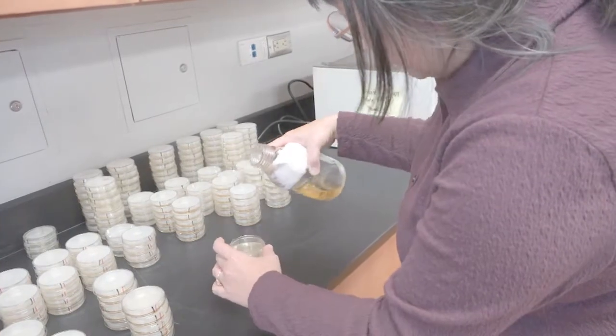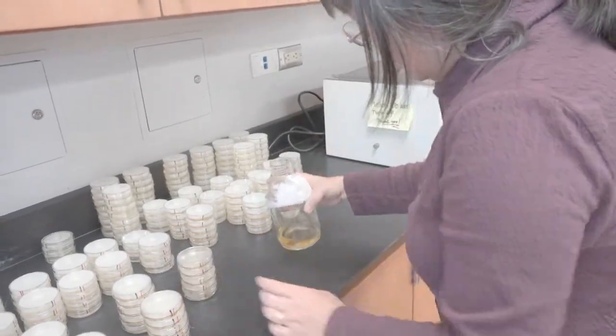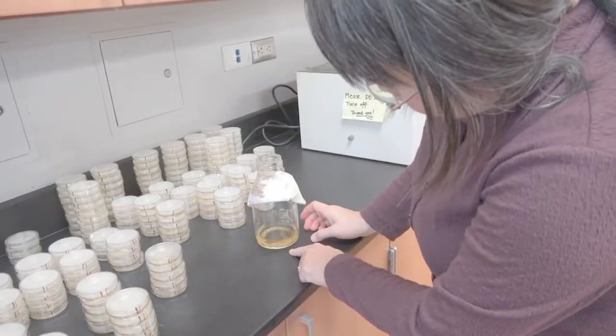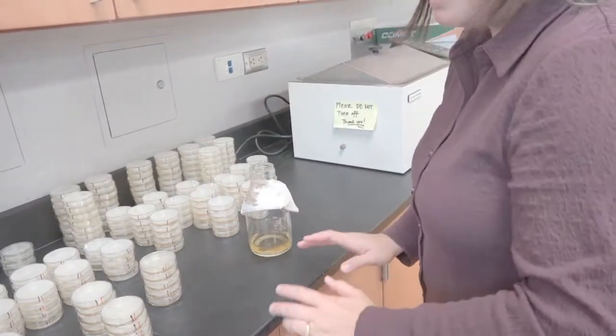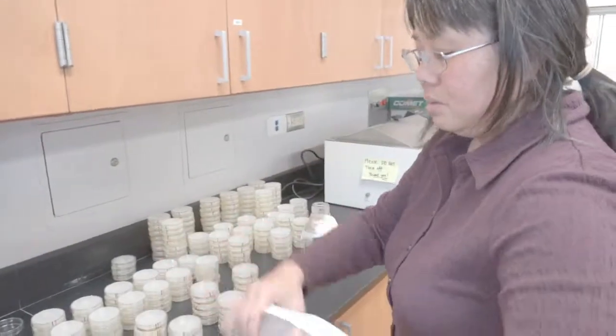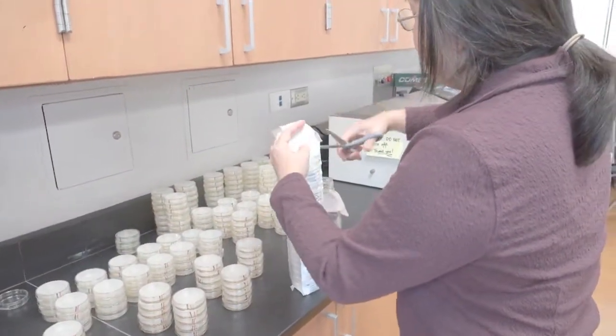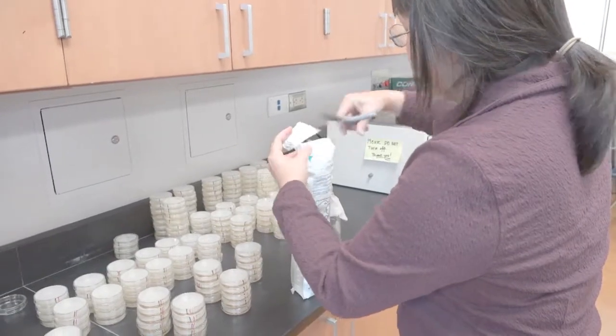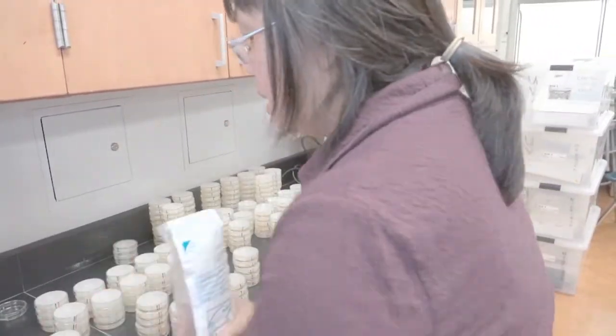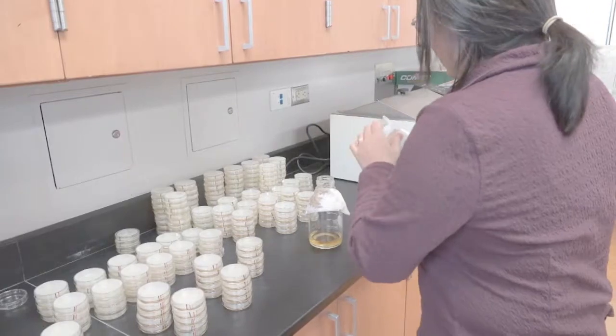It looks like I'm out of my plates. My agar, there's only a little bit left. That means I've got to pour quickly. I've got to find another sleeve, which I happen to have, and make sure that I work quickly now because that agar is probably going to start to gel soon.